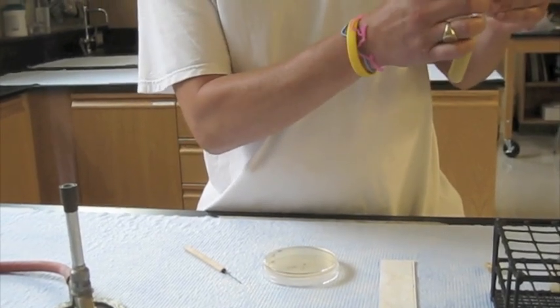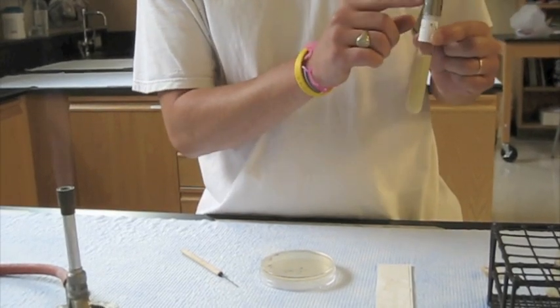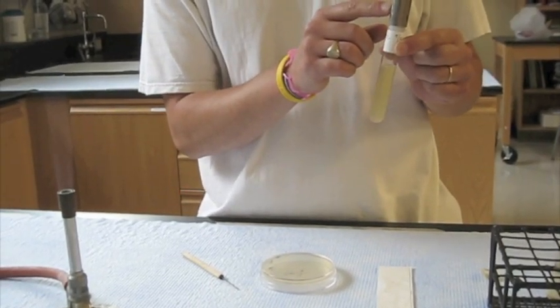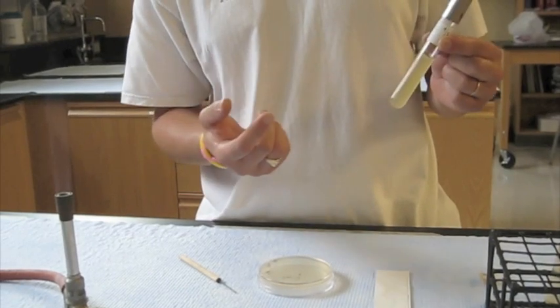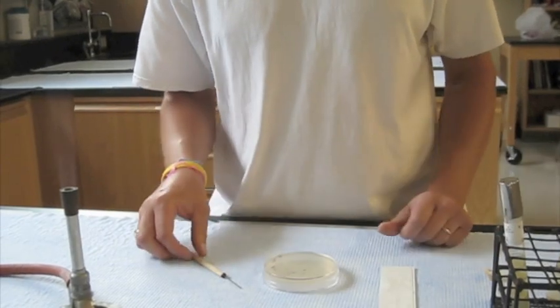Above the surface, where you will be able to still see what's going on. You really never want to put them on the lids, however, because it's very easy for the lids to be transferred from one tube to another, and then you could lose track of what's in your culture. So there's my stab, properly labeled.